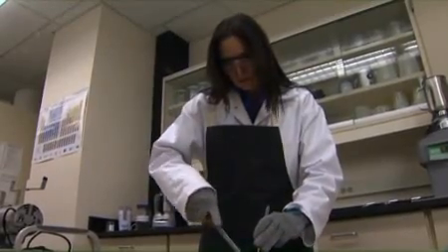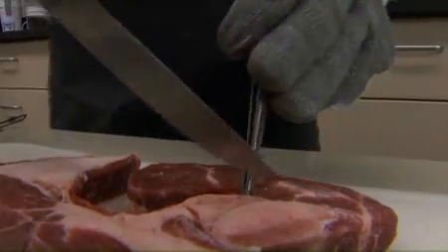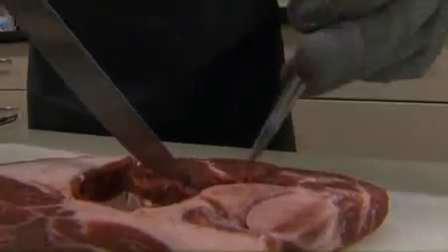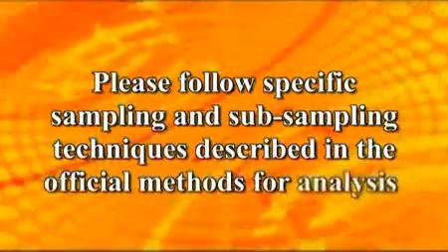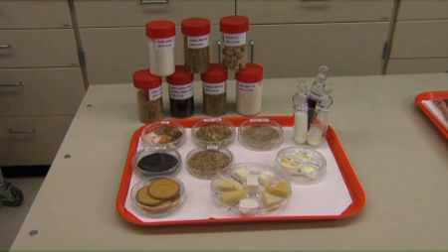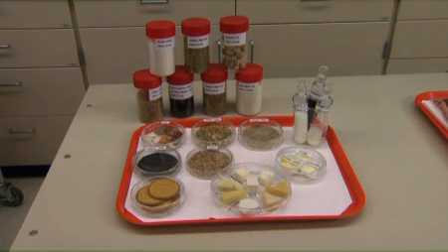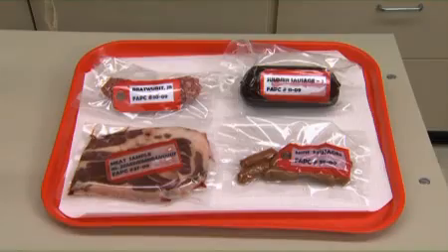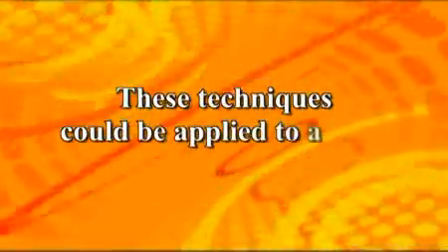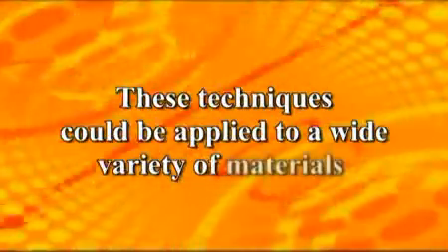A meat sample may require bone removal and, in specific cases, the subcutaneous and intermuscular fat should be trimmed. Please follow specific sampling and subsampling techniques described in the official methods for analysis. The Analytical Services Method for preparation of test samples focuses primarily on samples comprised of meat, animal feeds, grains, and dairy products. However, these sample preparation techniques could be applied to a wide variety of sample matrices.